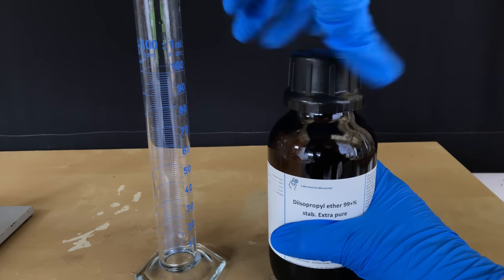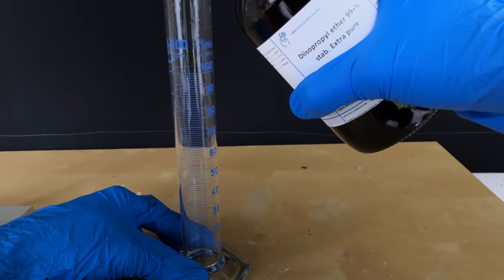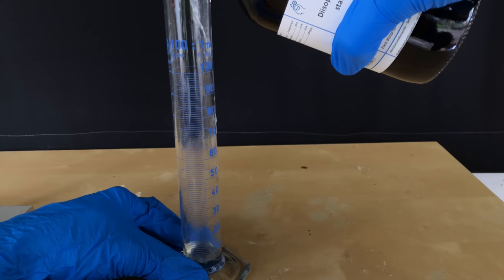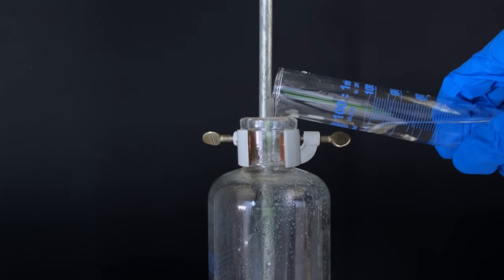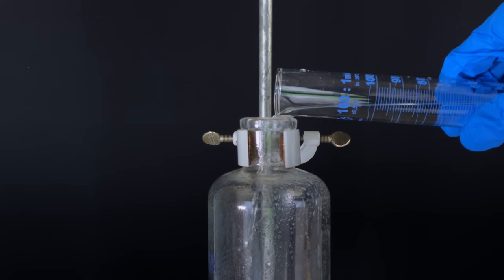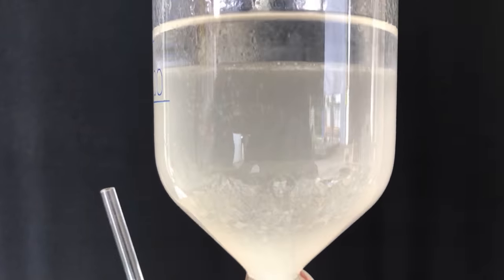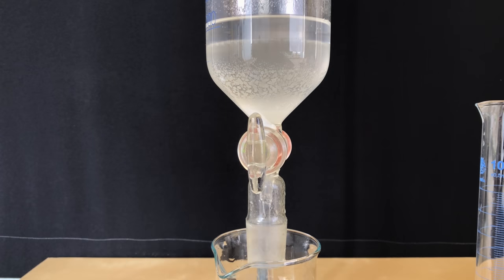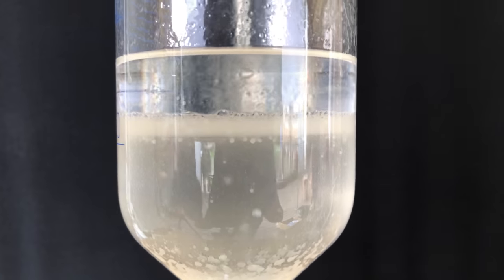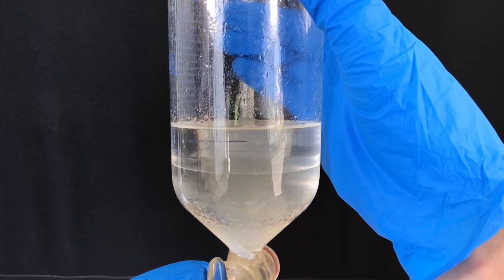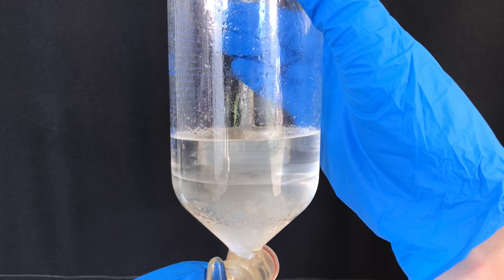Next, we used our favorite peroxide-loving ether, diisopropyl ether, to extract the product. Two extraction steps using 75 ml of diisopropyl ether each were performed. Fortunately for us, the DMF and the other contaminants should be poorly soluble in this ether, and if they dissolve, we will get rid of them in the next washing step. As the ether layer floats on top, the bottom layer was drained off first into a beaker before transferring the ether to a flask. The stuff from the beaker was added back into the funnel, fresh ether was added, and we did a second extraction.